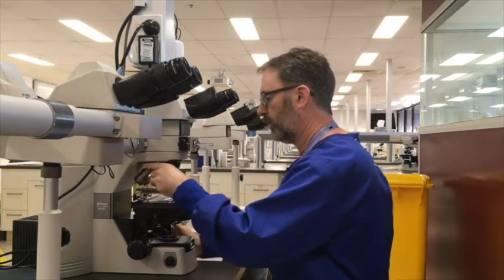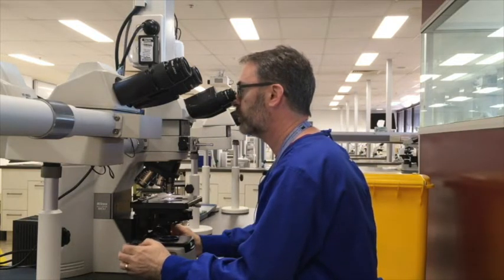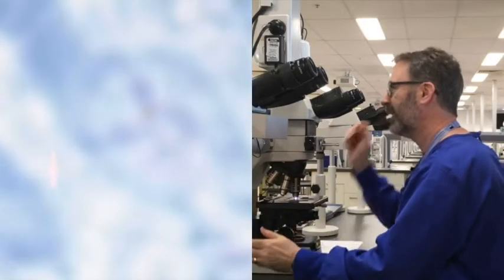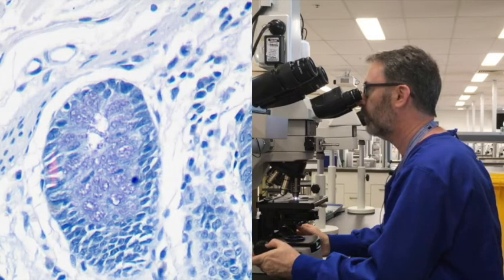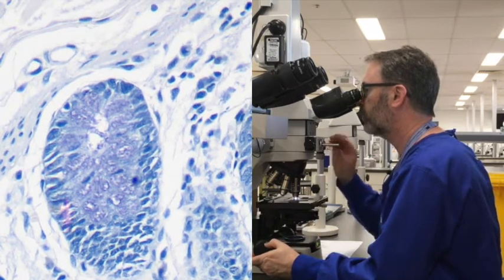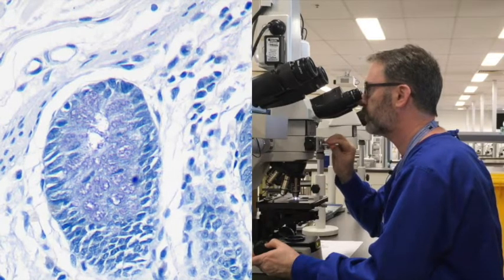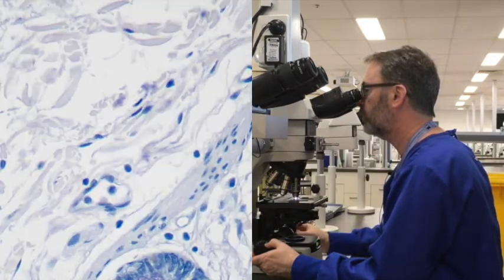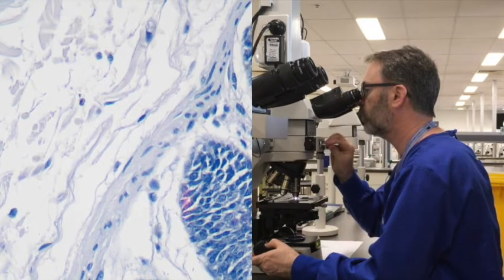If we have a look at that slide, first thing we'll notice is that there is clearly only blue staining, so there has been no eosin applied to this one, and it's very intense. So you can see a lot of blue staining, obviously, within the nuclei. The mucin, as we said before, can actually have a little bit of blue colour, but in this case it's really quite strong. The mucin within the goblet cells is just as strong as what it is within the nuclei.